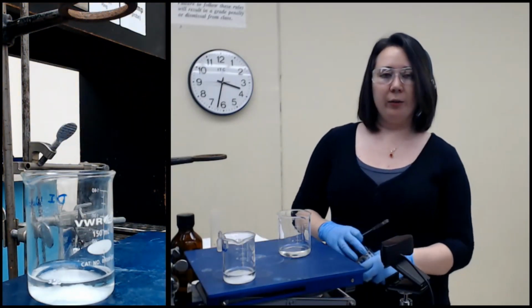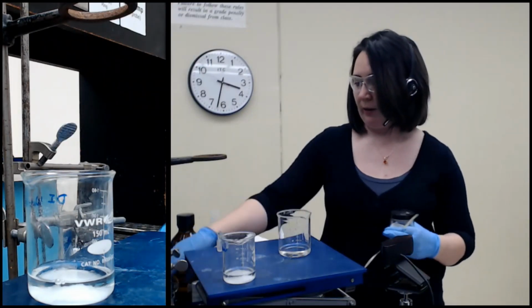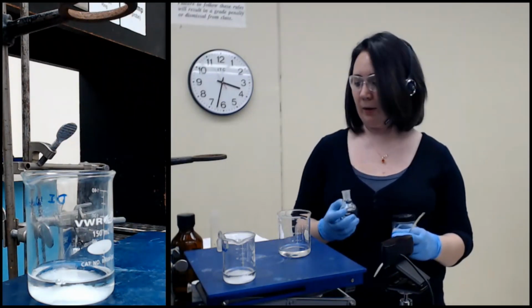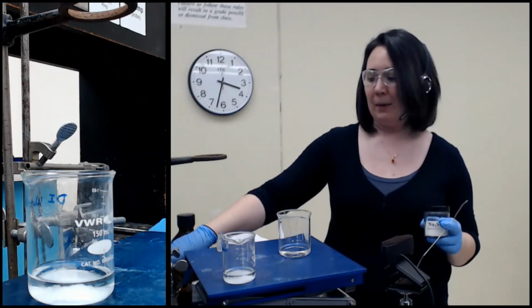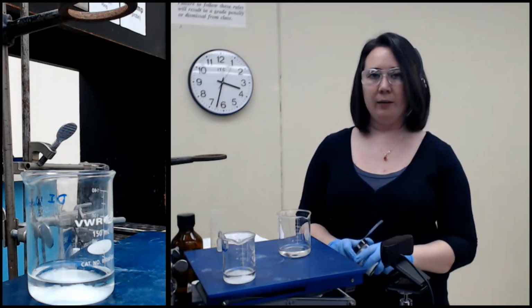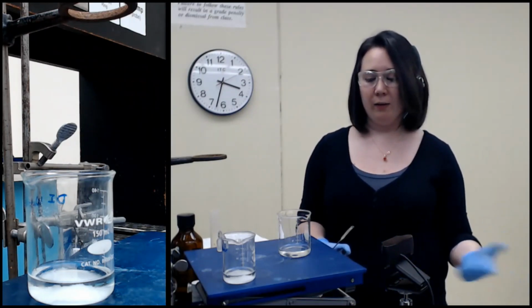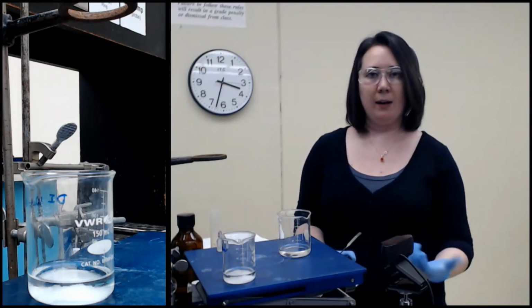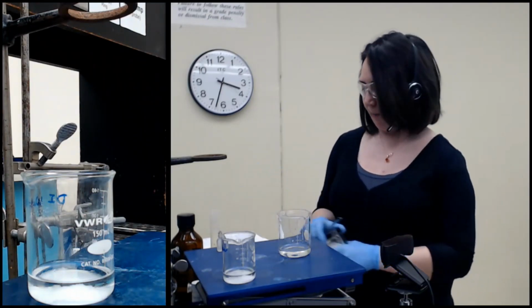What we're going to do after this is either filter or decant into a round bottom flask, and this will go onto a rotovap, short for rotary evaporator. I never actually say that out loud, so just rotovap from me. That's basically a giant vacuum distillation, and it is going to evaporate off the solvent and leave whatever is not a liquid at this pressure and temperature range behind in the flask. And hopefully that is our pure compound, whichever one we expect to be in here.